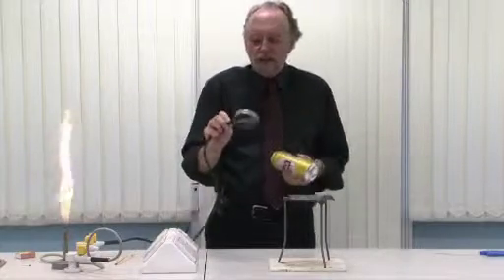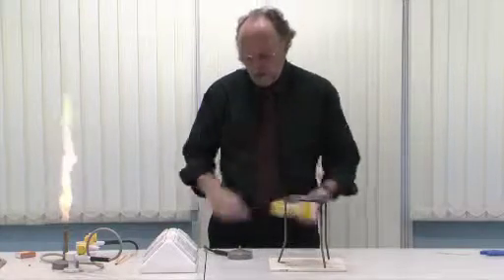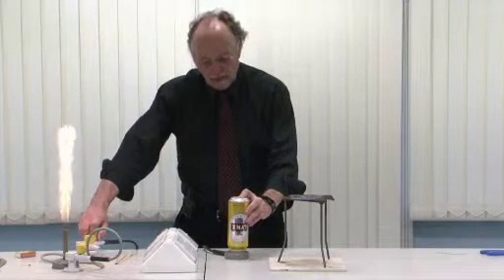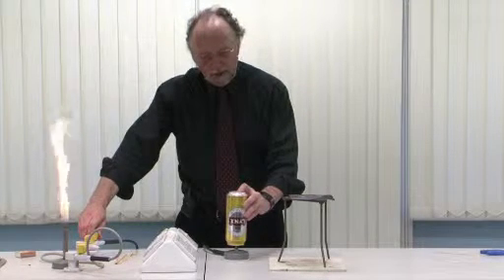You need to fill the can with gas. Take a Bunsen burner, unscrew the chimney, finger over the small hole, and fill it with gas. This can take a surprisingly large amount of time, and some gas will leak around, but it's not that dangerous. Don't worry about it.